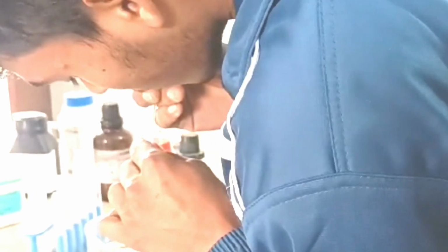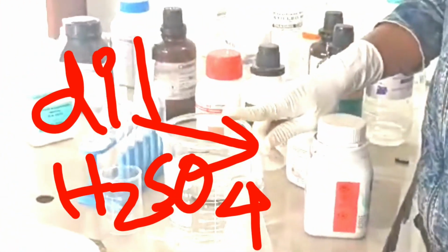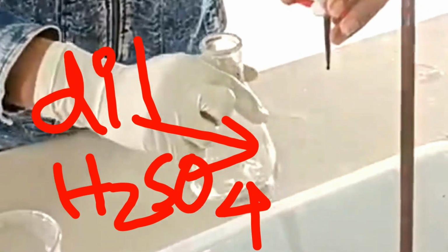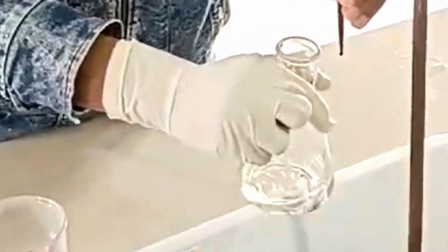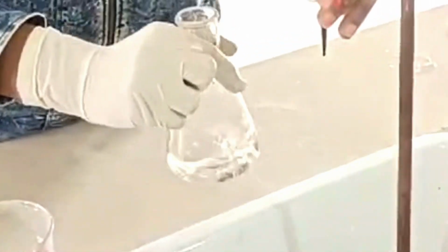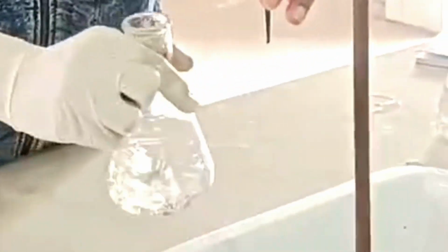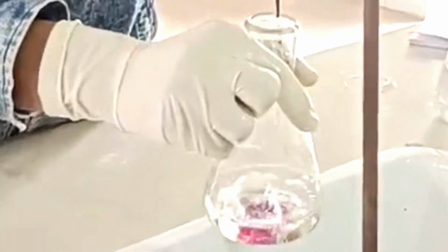Next, we have to pipette out 20 ml Mohr salt solution into a conical flask. After pipetting the 20 ml Mohr salt solution, you have to add 20 ml dilute sulfuric acid, and then we will go for titration as my student is showing. In this way you have to shake continuously until a permanent pink color appears.